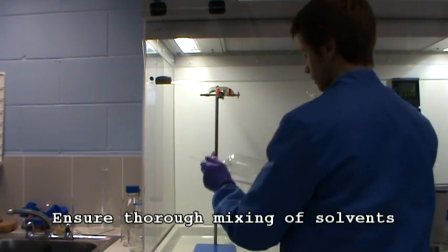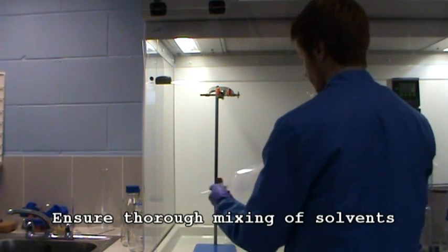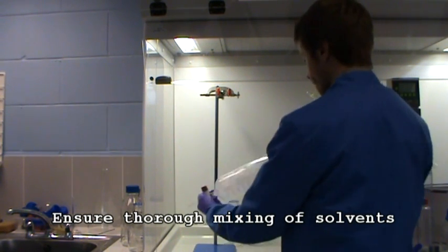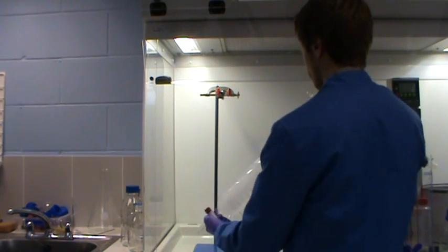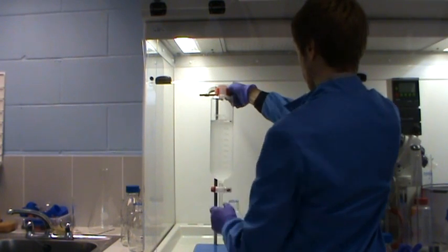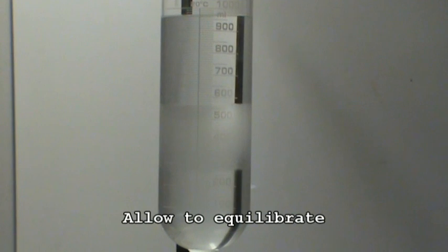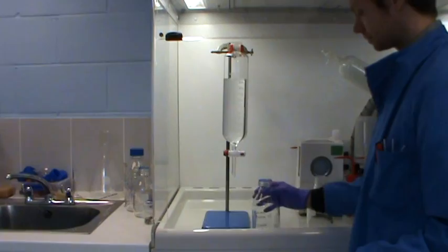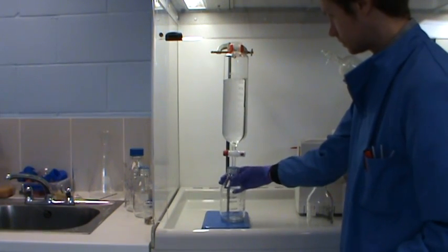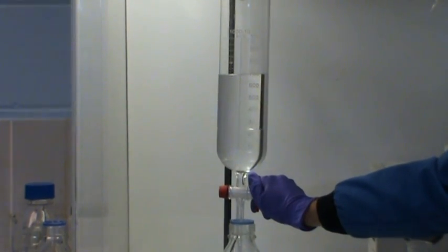Once the four solvents are added to the mixture, thorough mixing is needed to make sure they are completely mixed. Then allow the layers to settle completely. After settling you'll be left with two distinct phases. Collect each phase individually and label up.